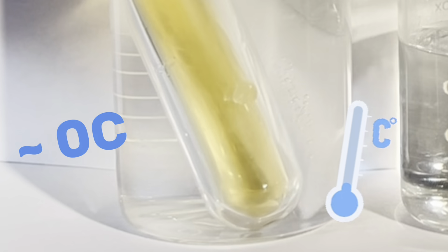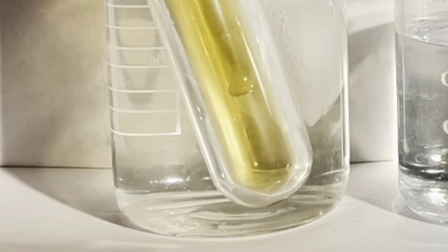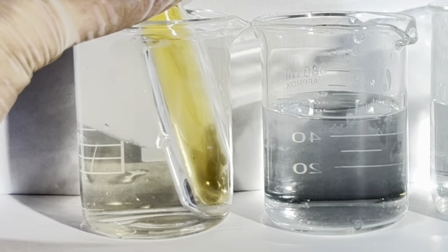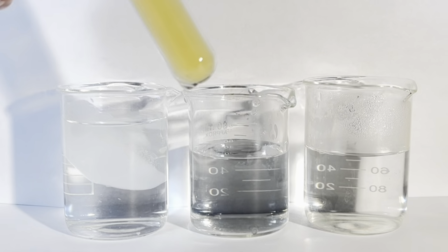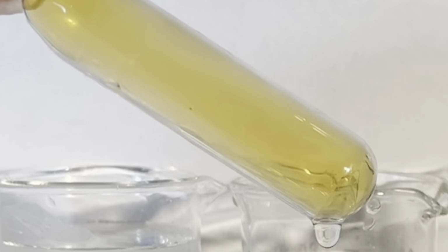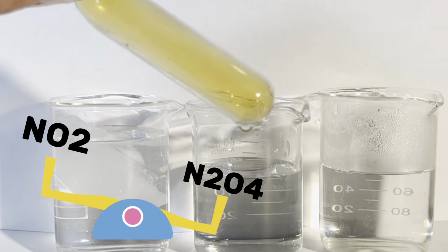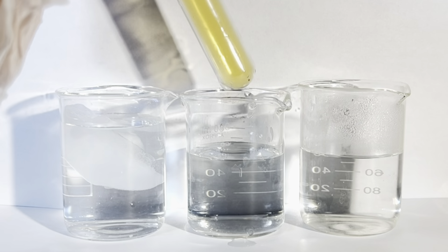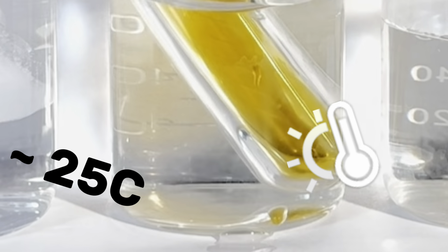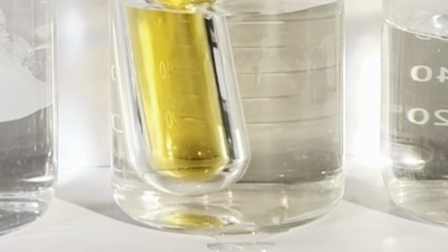Since the reaction going from the dioxide to the tetroxide is exothermic, we can treat heat as a product and, by quote-unquote removing it, drive the reaction forward. This is going to leave us with a mixture enriched in the tetroxide and depleted in the dioxide, just as Le Chatelier's principle predicted. Now I'm just warming the sample up to room temperature in a normal water bath, just to reduce the risk of heat shocking the glass and overexposing everything as well.